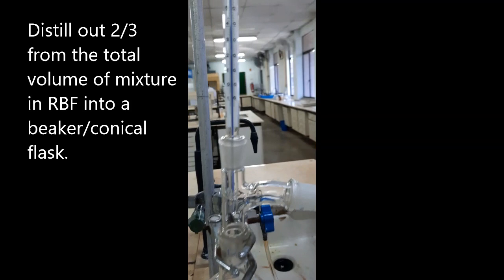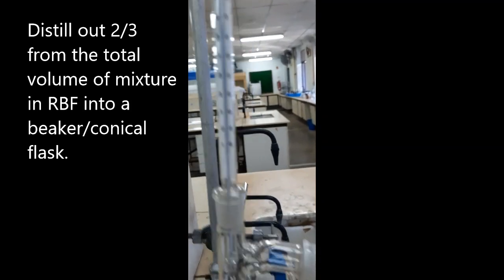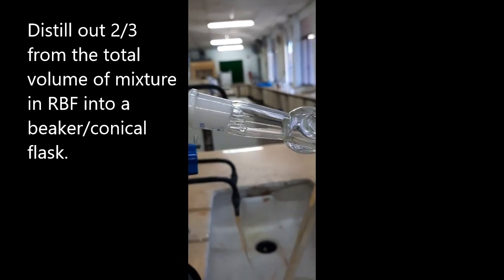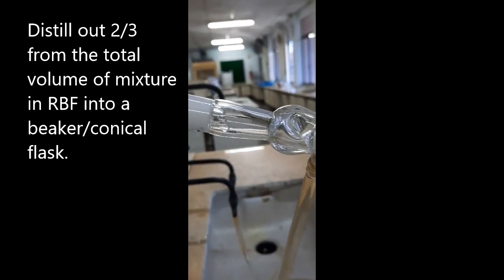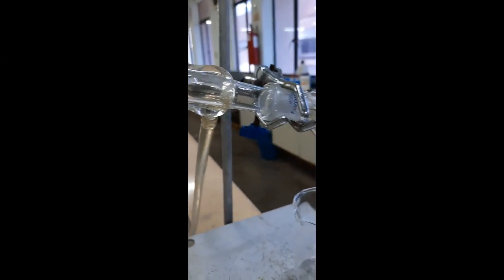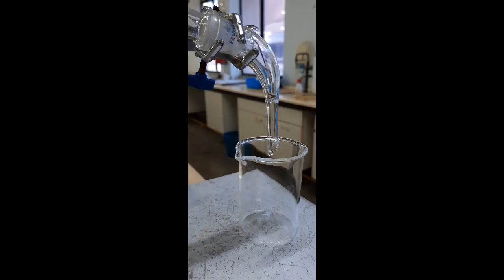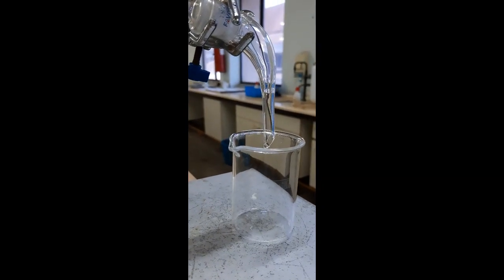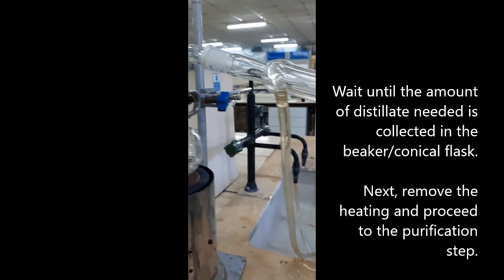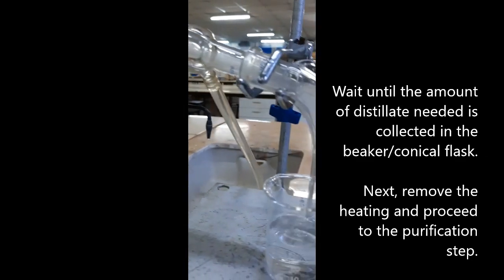Distill two-thirds of the total volume of the mixture into a beaker or a conical flask. Collect the right amount of distillate in the beaker.